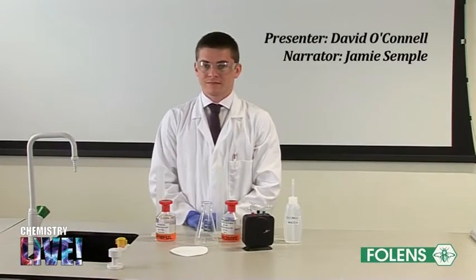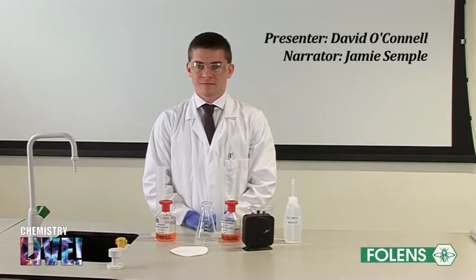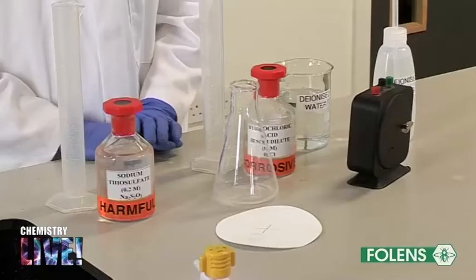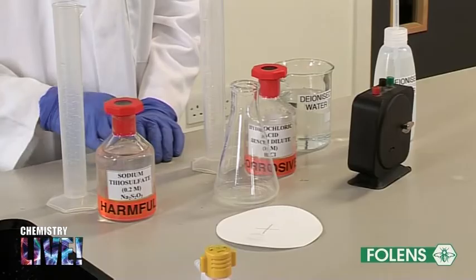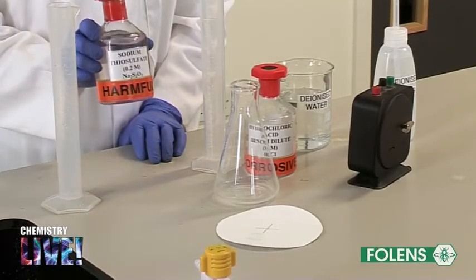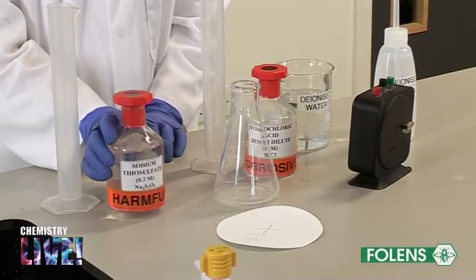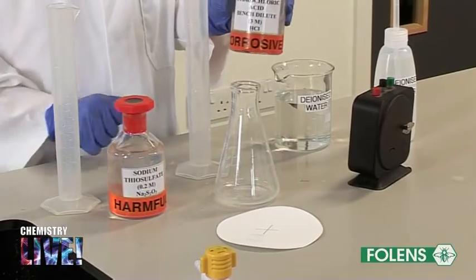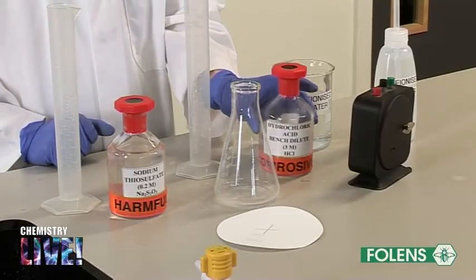Experiment to study the effect of concentration on the rate of reaction using sodium thiosulfate and hydrochloric acid. In this experiment, we will take a number of solutions of different concentrations of sodium thiosulfate. We will then react each of these solutions with a certain quantity of dilute hydrochloric acid in order to study the effect of concentration on the rate of reaction.